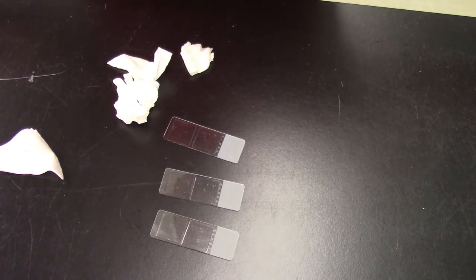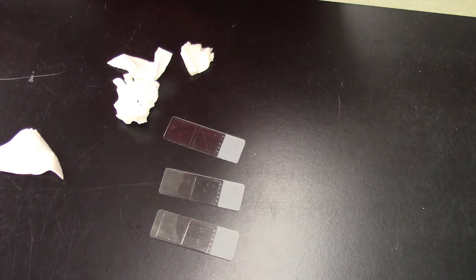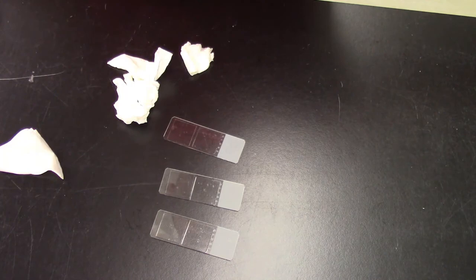You form a wedge out of a piece of paper. You use some alcohol and you carefully remove the oil. You will see that it will take actually some more time to do that than cleaning this haze that we just did right now. So just keep this in mind.